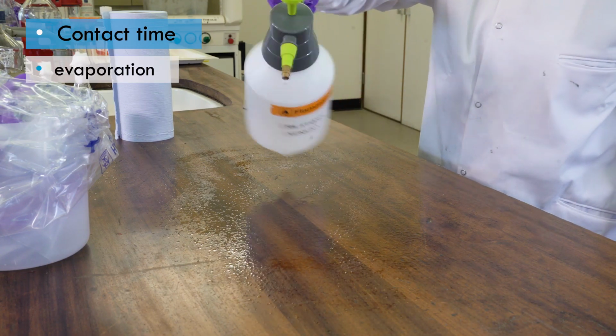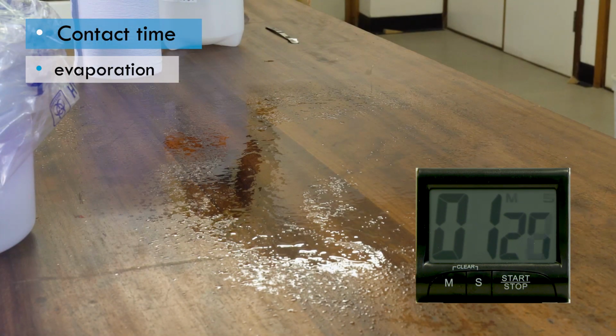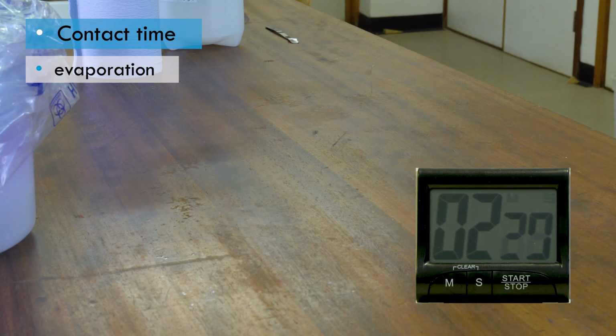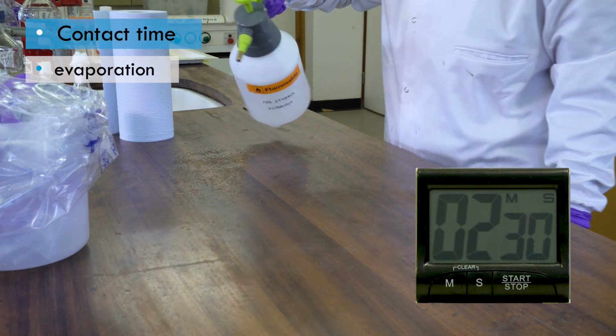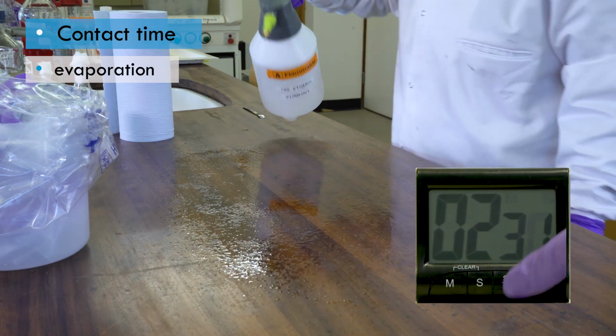It is important to note that some disinfectant products may evaporate before the full contact time passes. This is more likely in warmer environments. Where this occurs, disinfectant must be reapplied to the surface and left for the remaining time to ensure the full contact time is achieved.